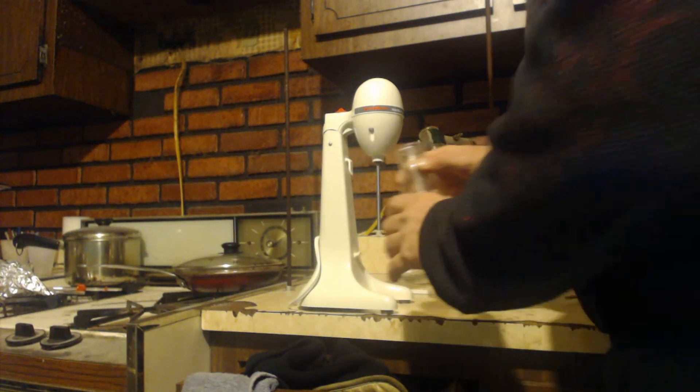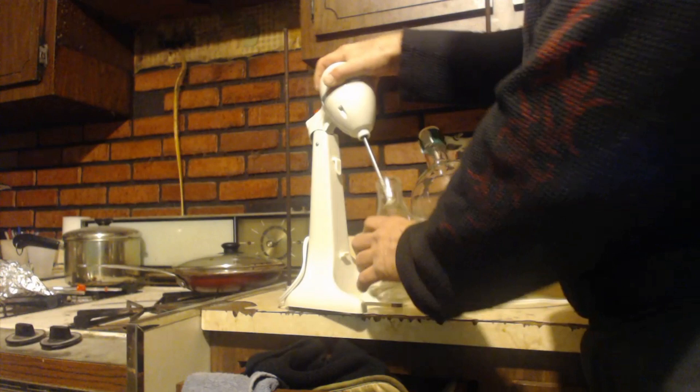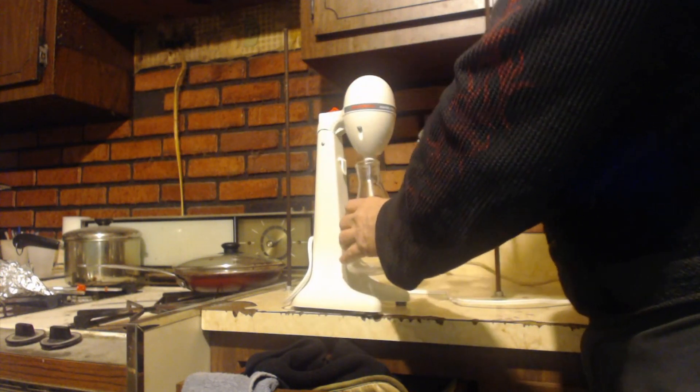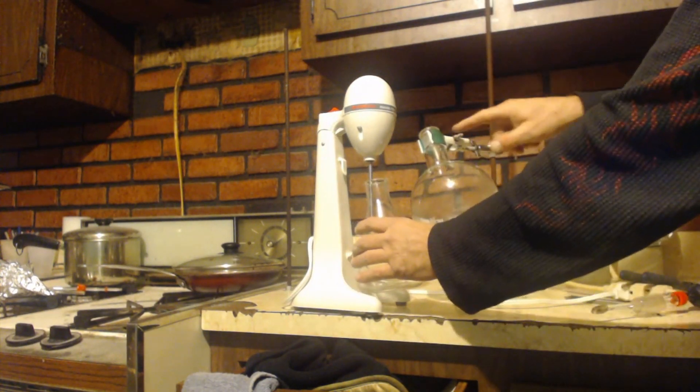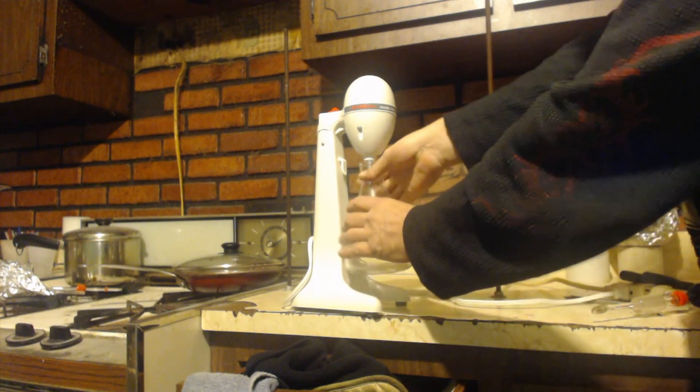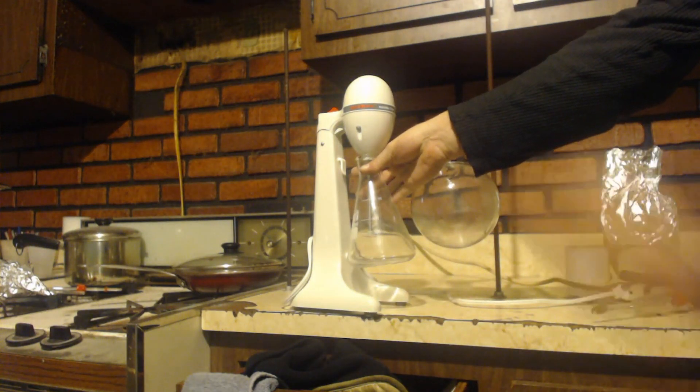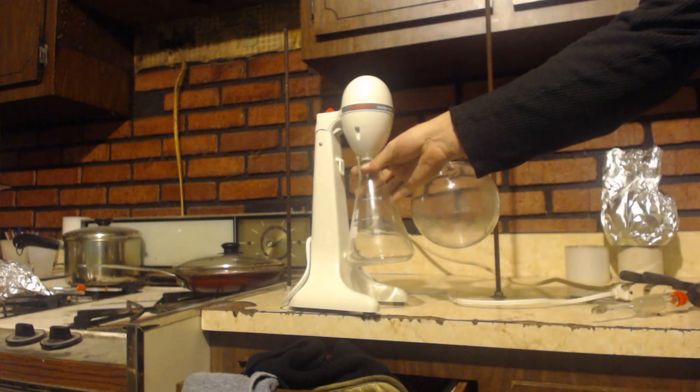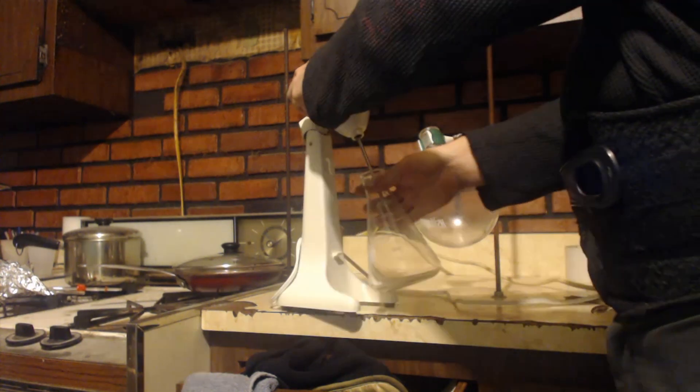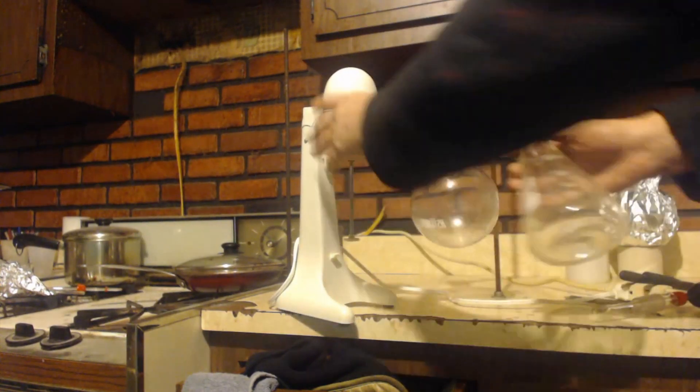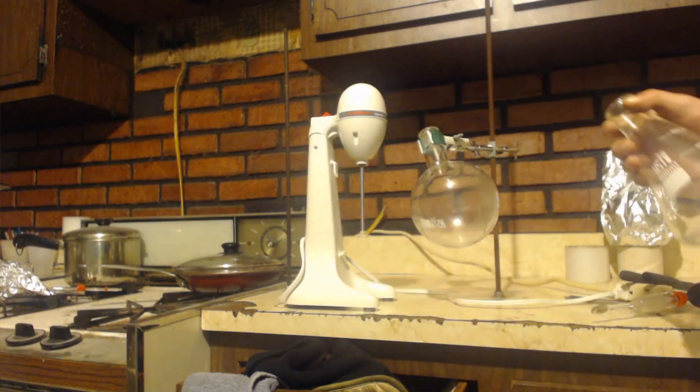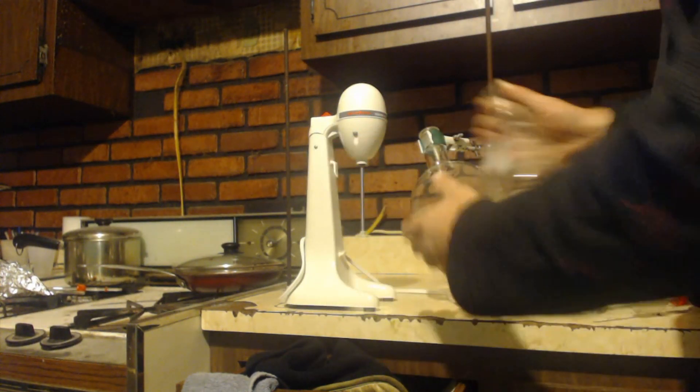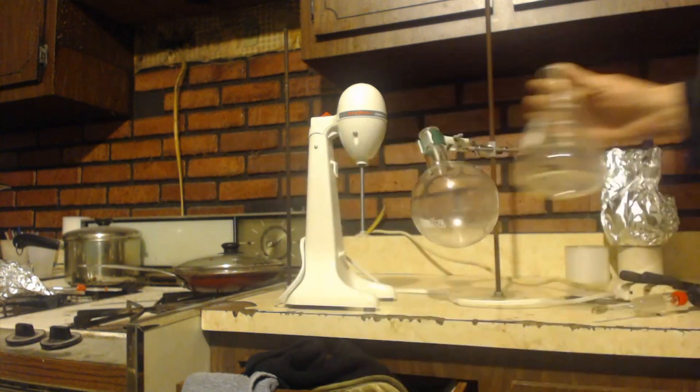But look, it does work. You can use a clamp like this over here, clamp this up in position and you can see I can turn it on. And let's say you wanted to use the round bottom flask, you can't get it in close enough, it's too bulky.